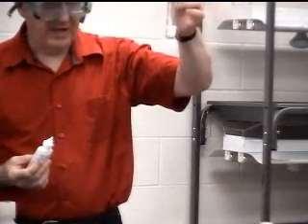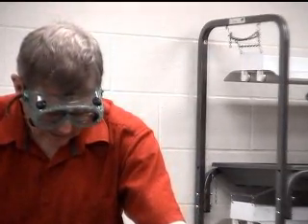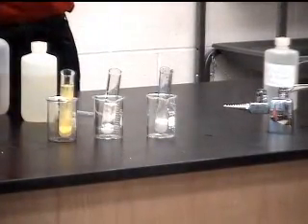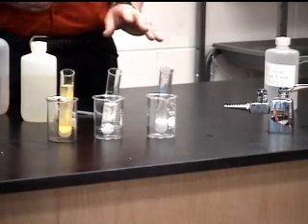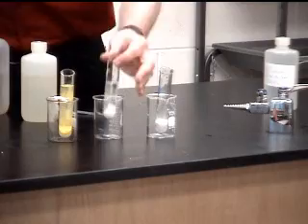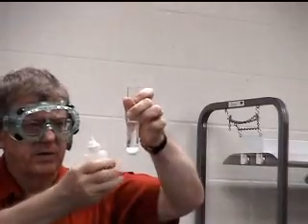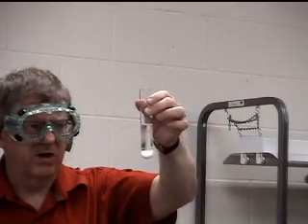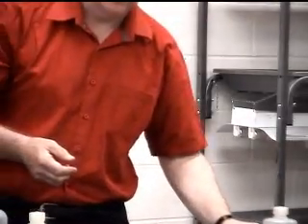lead chloride precipitating out. Of course, it takes a while for this to settle, but if you've added enough chloride, you're going to reach an equilibrium in which the addition of any more chloride will not create any more precipitate. It looks as if all of the lead has come out. In this system, we have the lead chloride at the bottom, and I've added more potassium chloride, and you can see there's no further precipitate. So one might think that all of the lead has precipitated out.